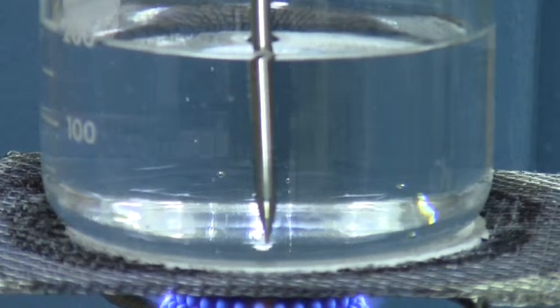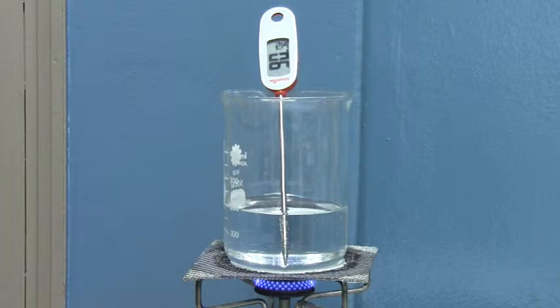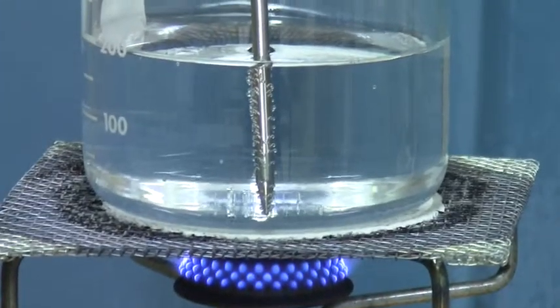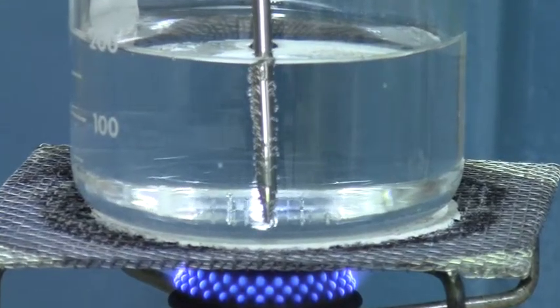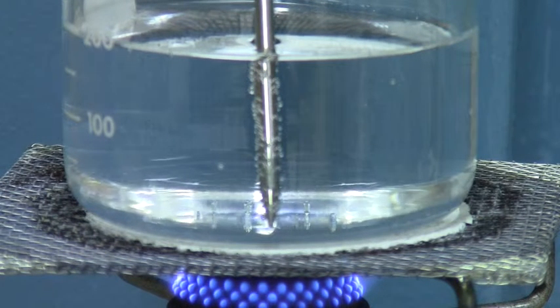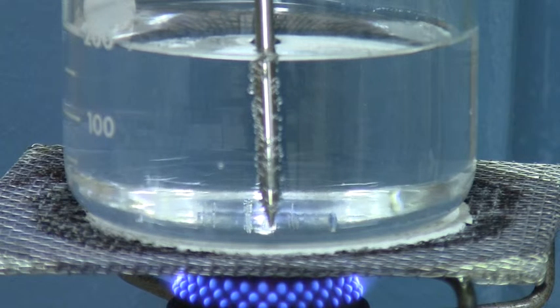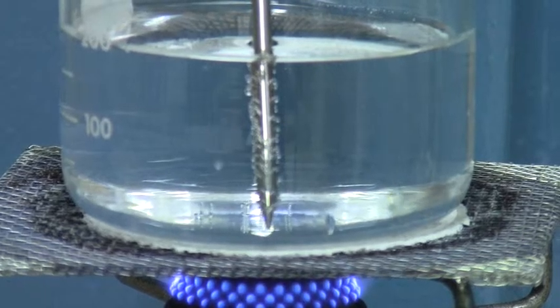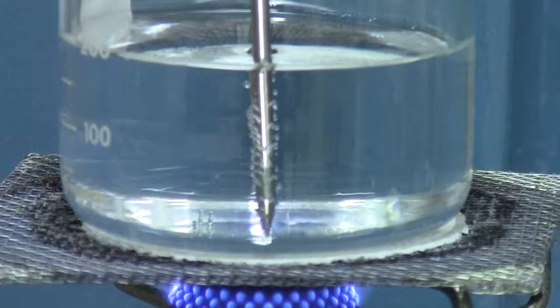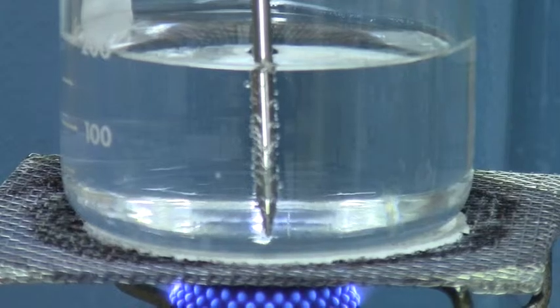But the water is not yet boiling. You can see bubbles forming and coming up to the surface. The bubbles are forming on the bottom of the beaker and along the temperature sensor. These are bubbles of dissolved gases coming out of solution as the temperature of the water increases. As water becomes hotter, it can contain less dissolved gases, so the excess gases start to bubble out.